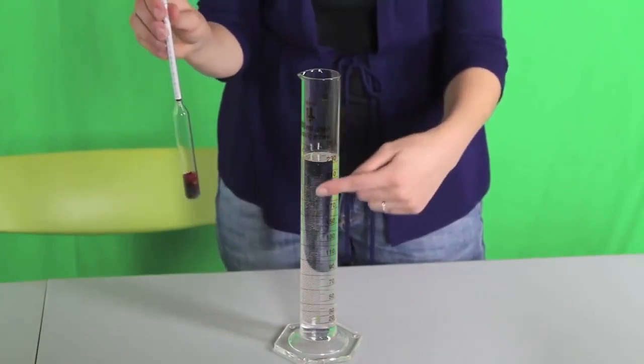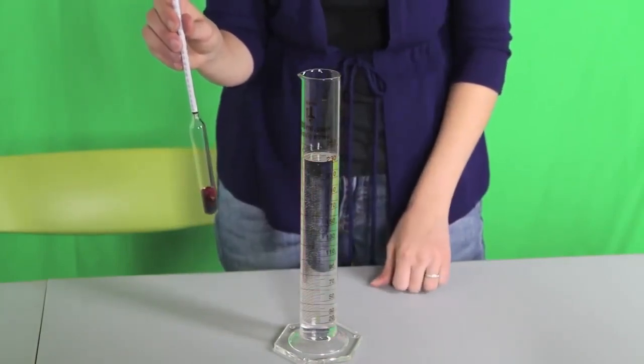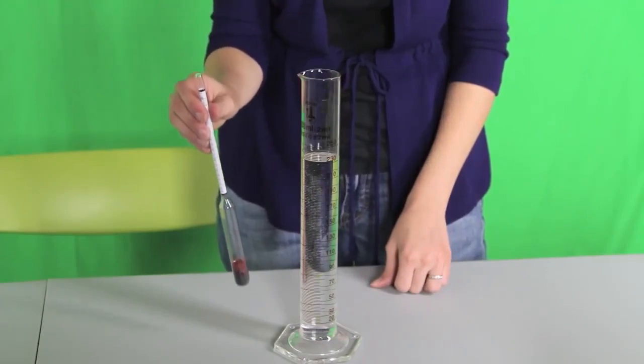Both the hydrometer and the test cylinder have been cleaned and sanitized earlier and allowed to air dry.